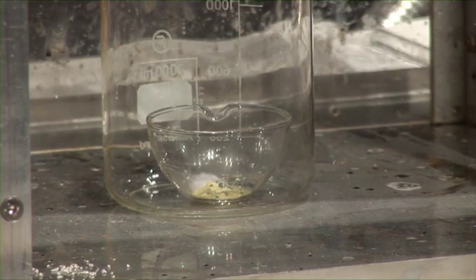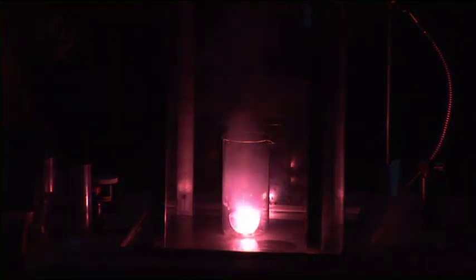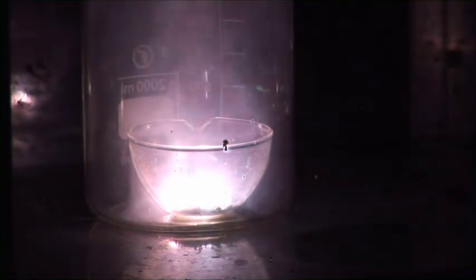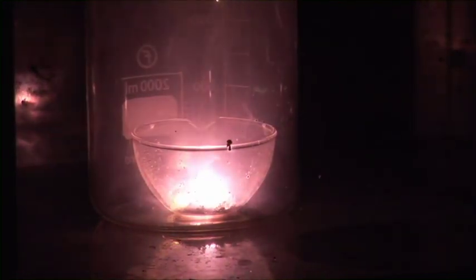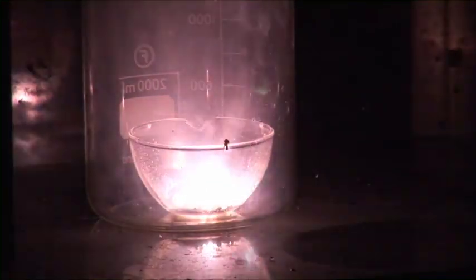If we have the lights down, maybe we can see a reaction take place. It's caught fire — that's a good sign. And the lithium is now burning in the oxygen produced by the potassium superoxide. This brilliant white light is the lithium reacting very, very quickly, very vigorously with the oxygen.